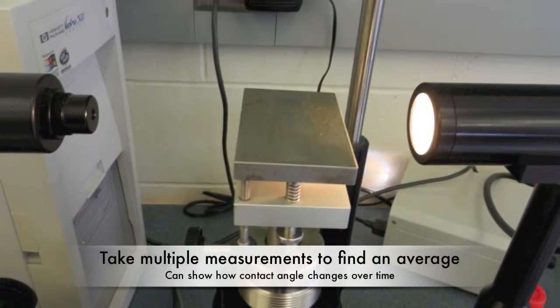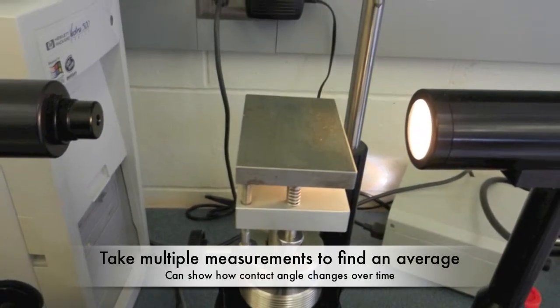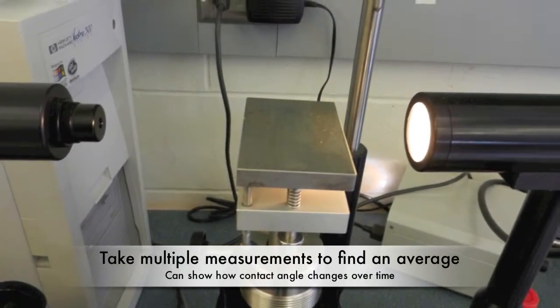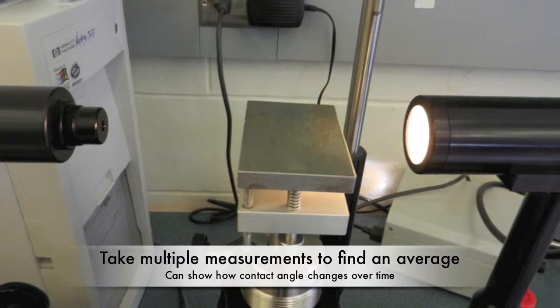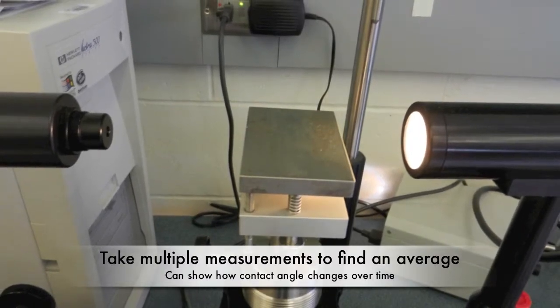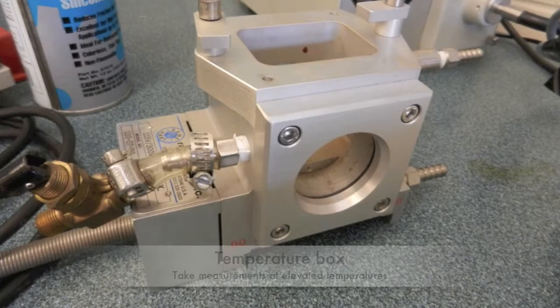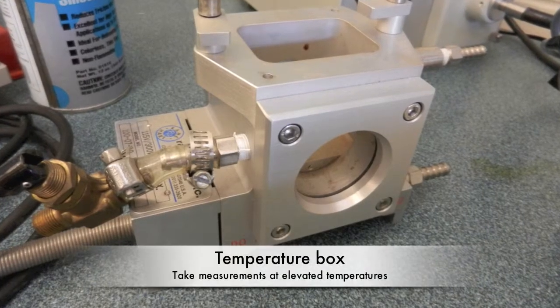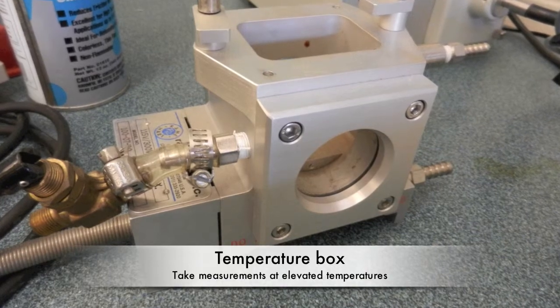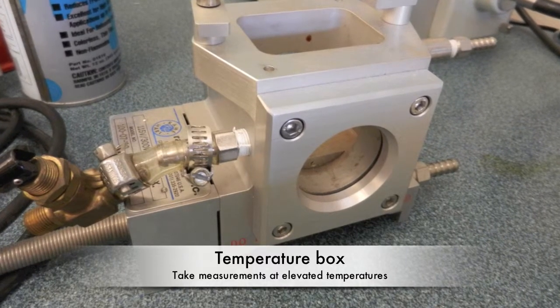Take multiple measurements to get an average contact angle. You can also take measurements of the drop after certain amounts of time, showing how the contact angle changes over time. A temperature box can also be used to measure contact angles at elevated temperatures.